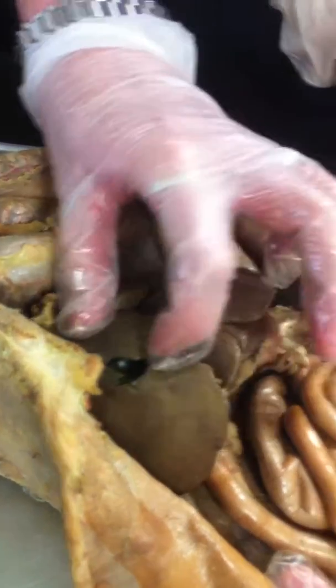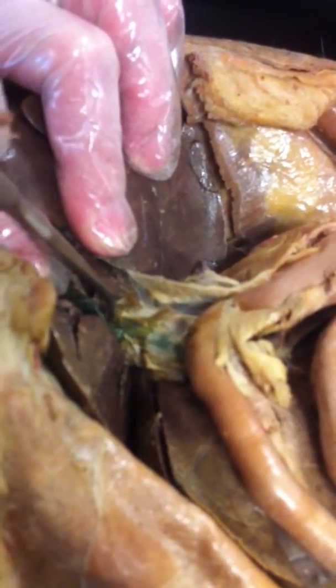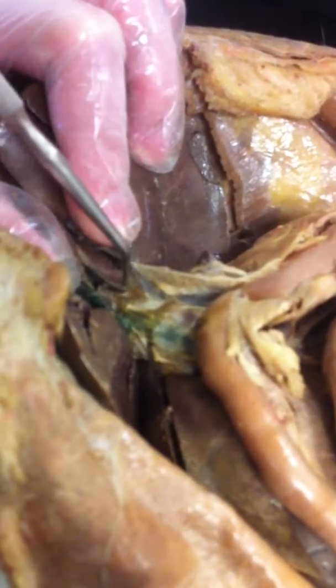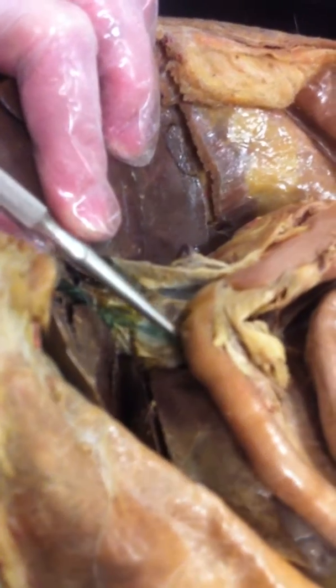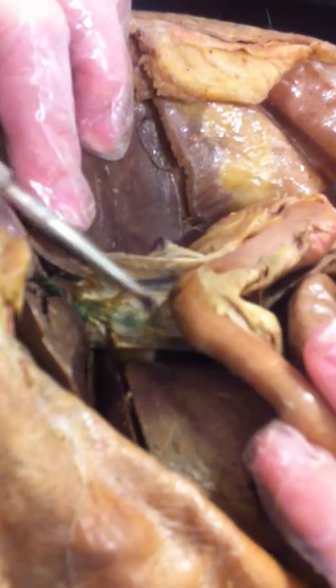The gallbladder is that green thing. The neck of the gallbladder you can sometimes see. You can in this one. It's kind of wrinkled up. But anyhow, the neck of the gallbladder is called the cystic duct. And that and the liver are squirting bile into the common bile duct, which is here, this green thing going into the intestine. See it right there? That green thing.